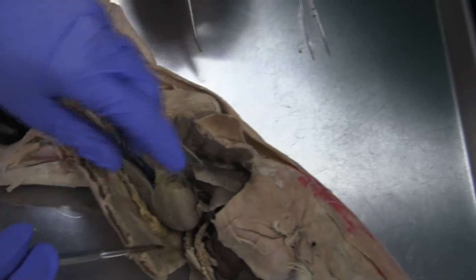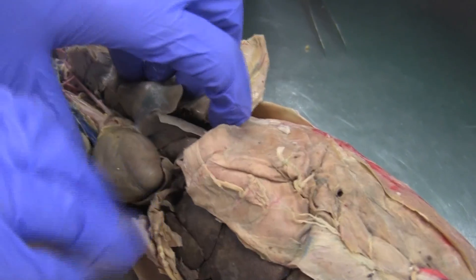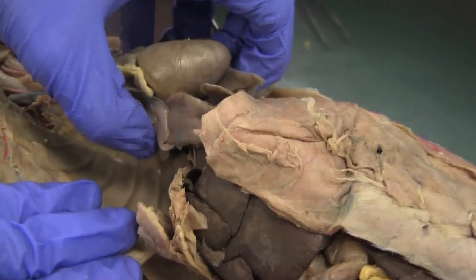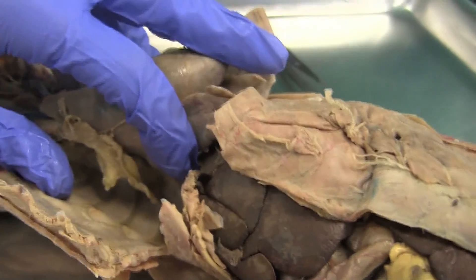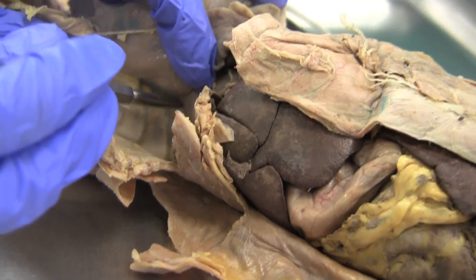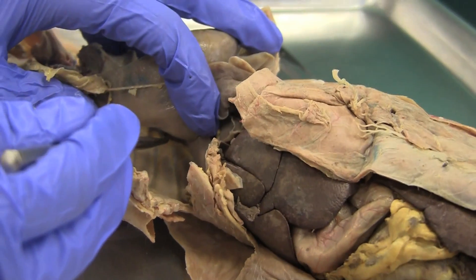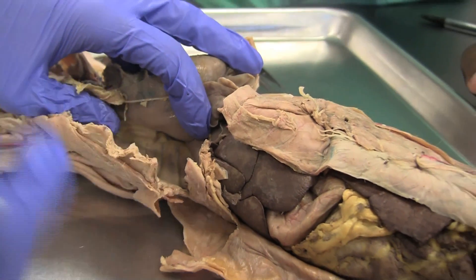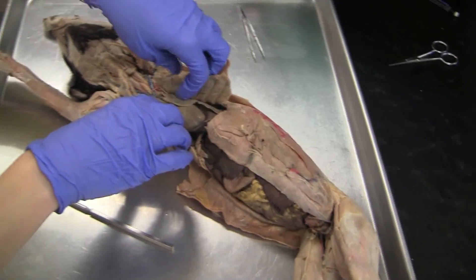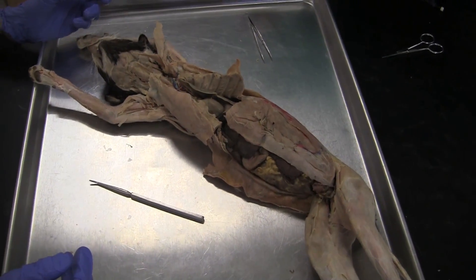And then your azygos vein is going to be — so if it's still in the thoracic cavity and it's underneath the heart, it's the azygos. And that's it for above the diaphragm.